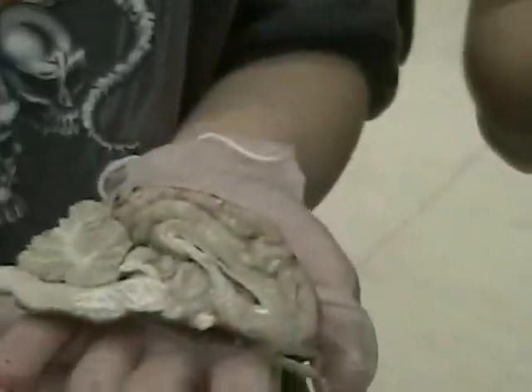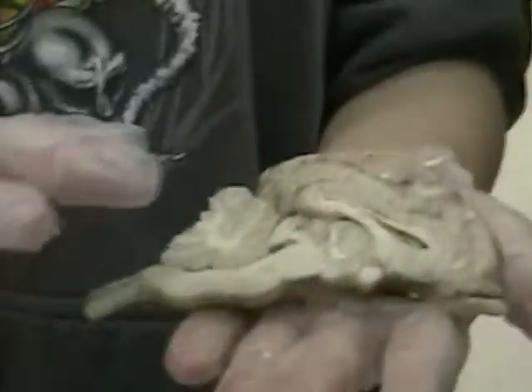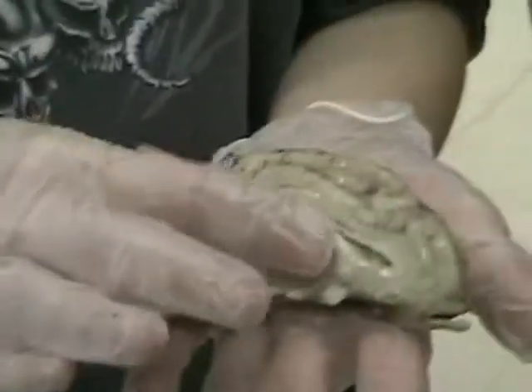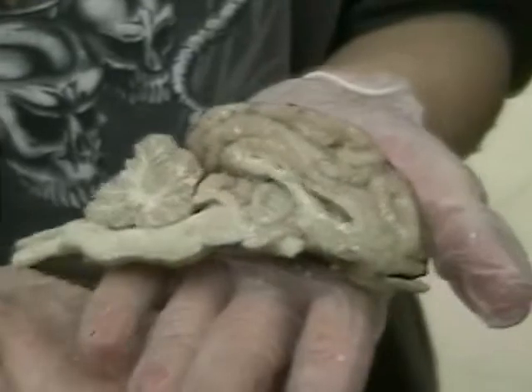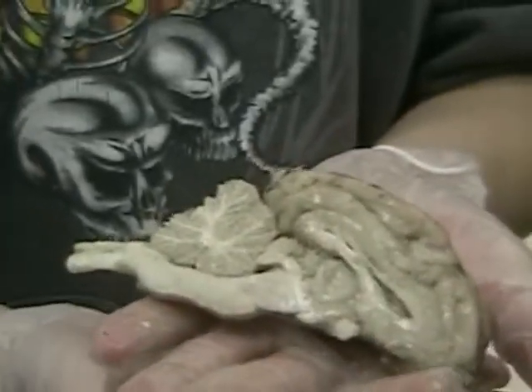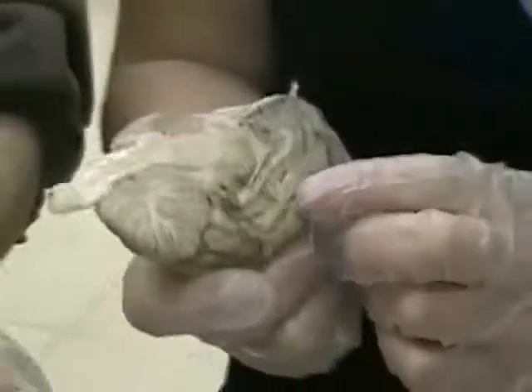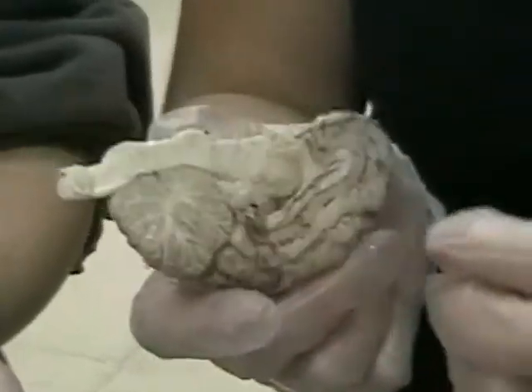Hypothalamus — it's right here and it regulates body temperature and things like that. This is the corpus callosum and it sends impulses between the two hemispheres. Very nice, thank you, excellent job.